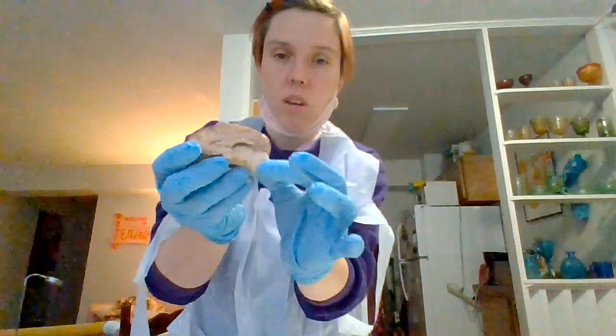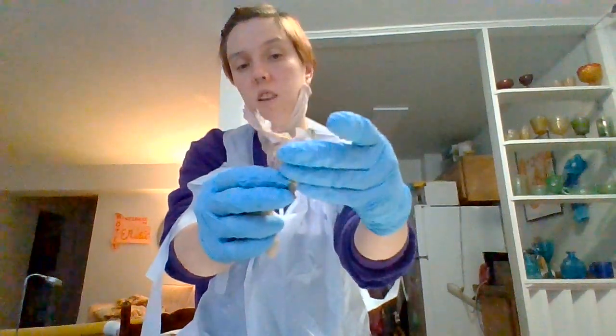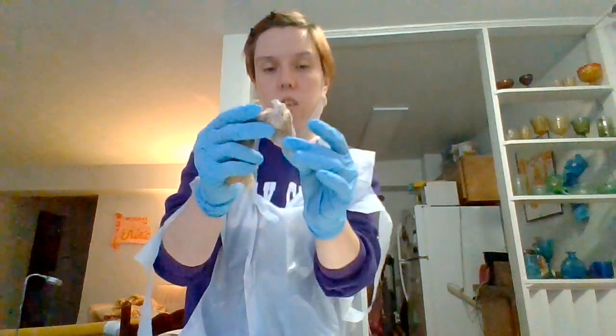So then down here we have the midbrain. The midbrain is, what would you call it? I'm losing my words. Oh, the highest part of the brain stem. Now down here, I'm so sorry, this is the part that I yoinked off the brain. It's got the medulla oblongata right in there, and the medulla oblongata is the bottommost part of the brain, the part that attaches to the spinal cord, right there.